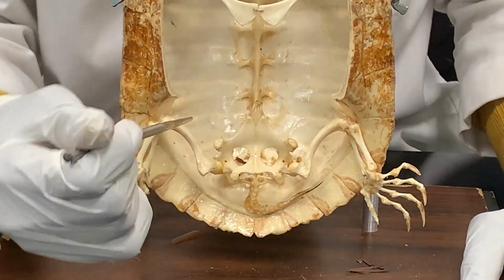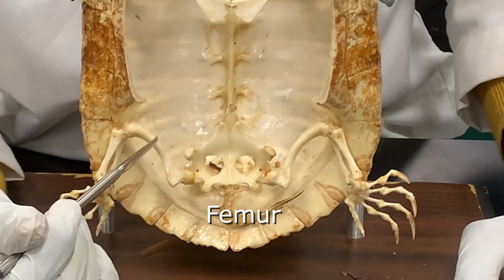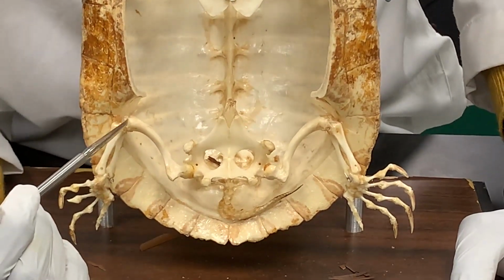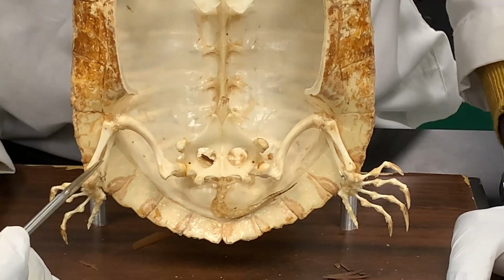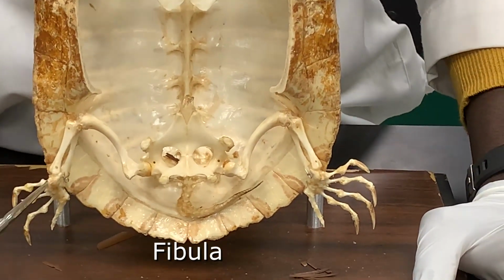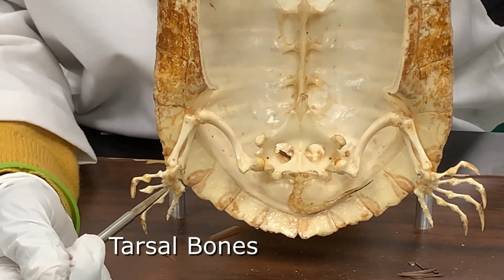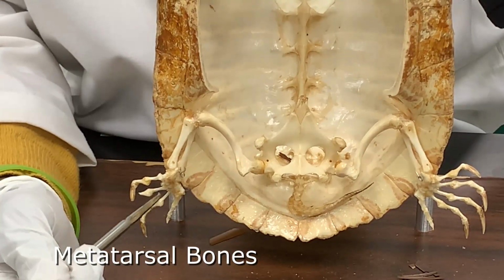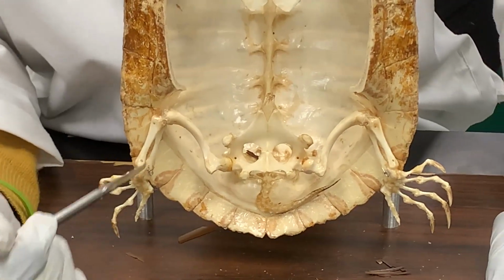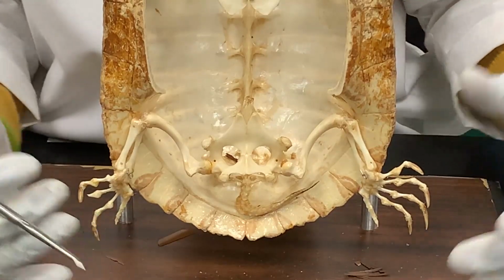What you're looking at right now is the femur, which is one of the longest bones of the appendages. Attached to the femur is the tibia, which is what you have here, and this is the fibula here. Next to that are the tarsal bones, then the metatarsal bones, and then the phalanges. All of these bones have muscles attached to them that help them to move.